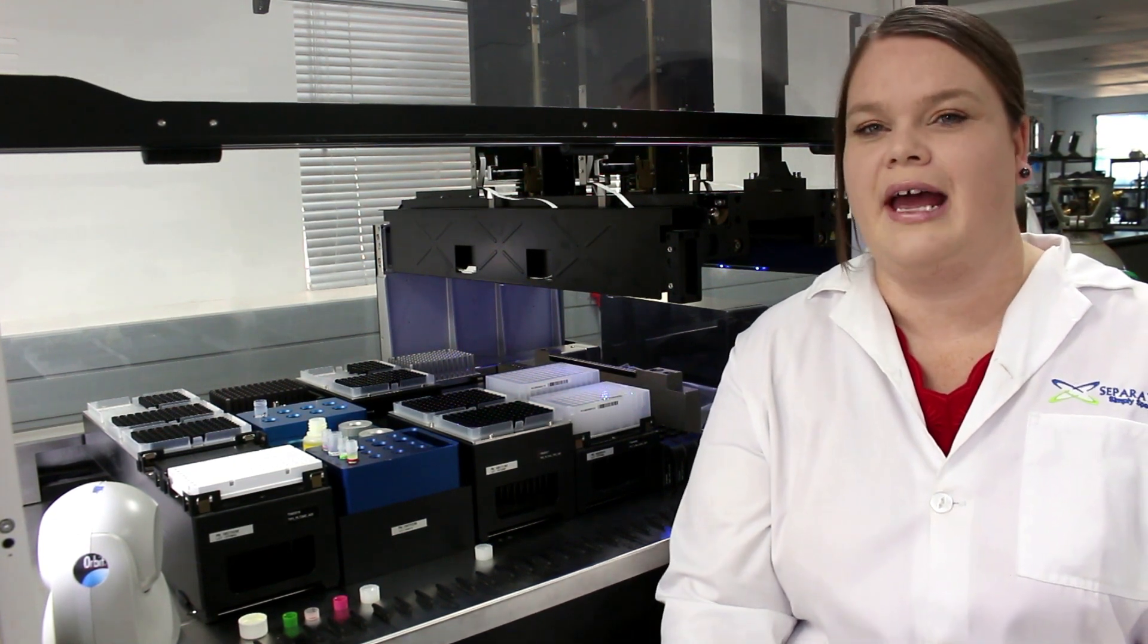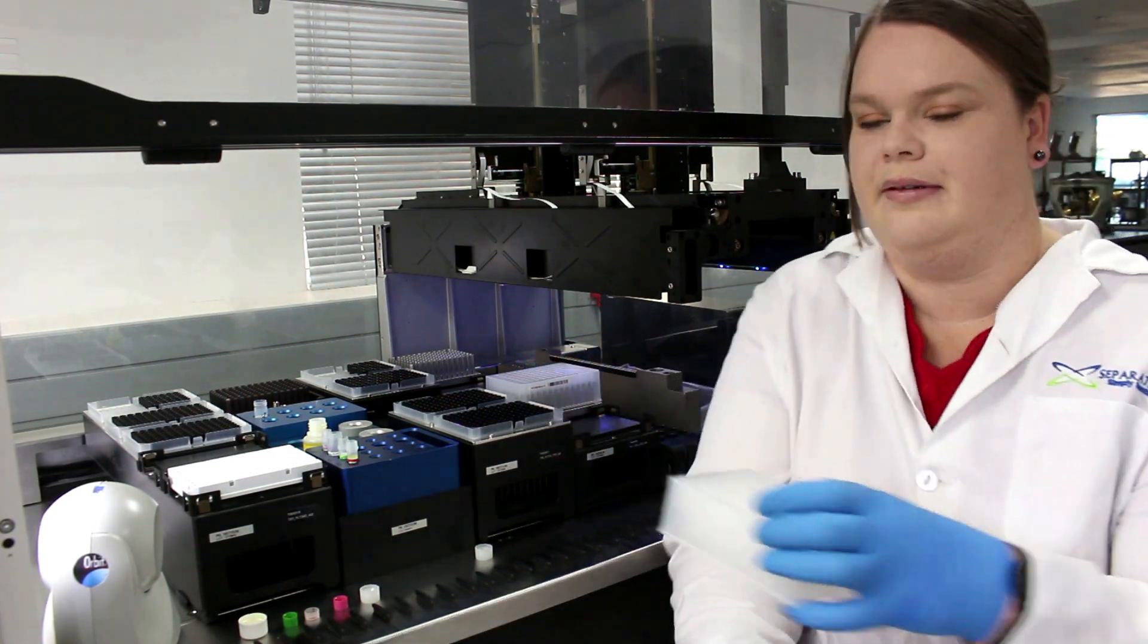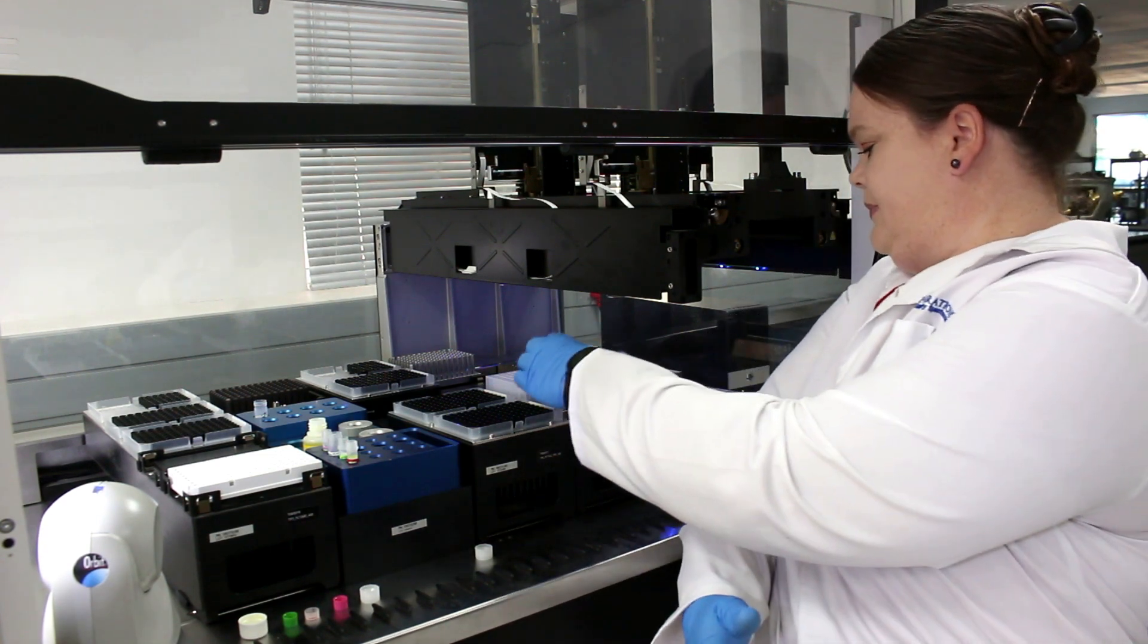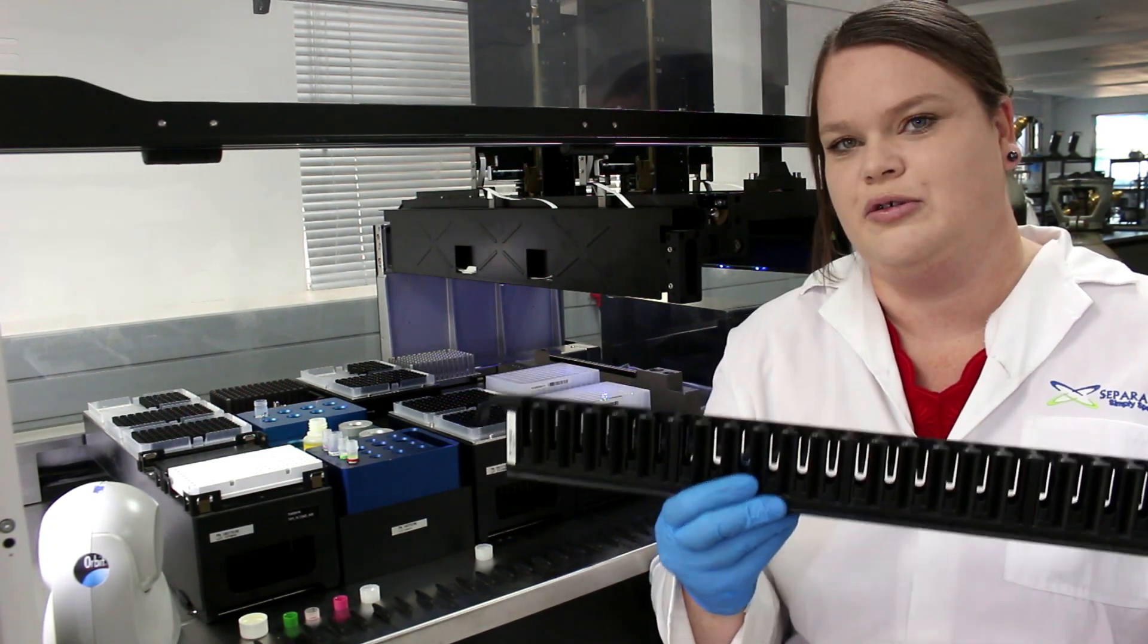The IQ Check Prep is able to do both DNA extraction and PCR setup. In order to do this, you need to load your enriched sample either in a 96 deep well plate or in either 5ml or 15ml tubes in racks.